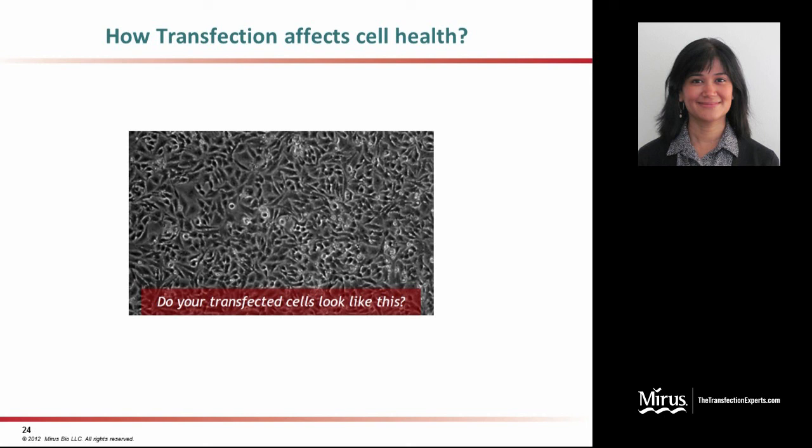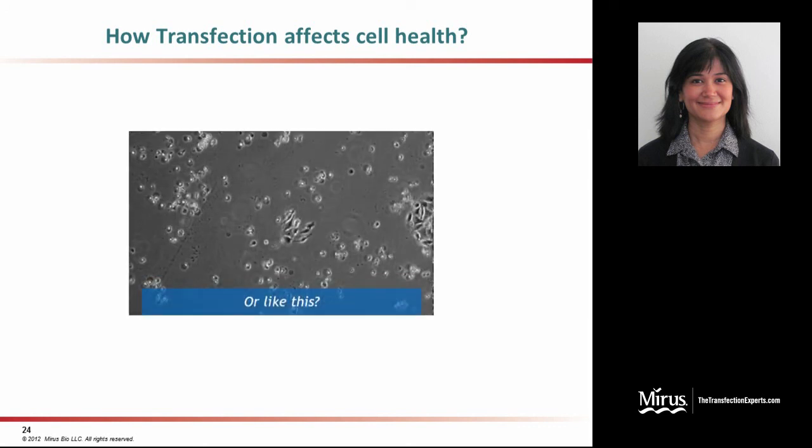Typically, you would want your cells to look healthy and morphologically fine, have no effects on cell viability, etc. following transfection. These are HeLa cells that have been cultured and transfected using several different transfection reagents. A lot of different labs use HeLa cells as their cellular model. Unfortunately, oftentimes, depending on the transfection reagent that you used, your cells will end up looking like this.